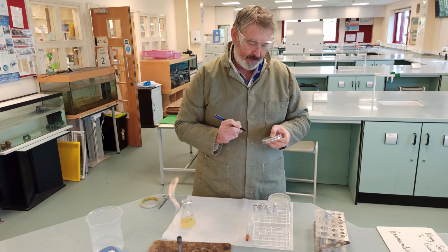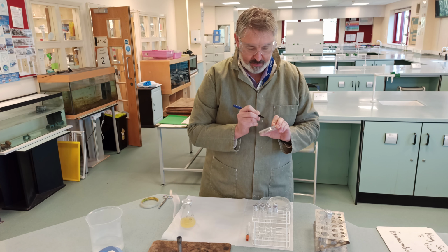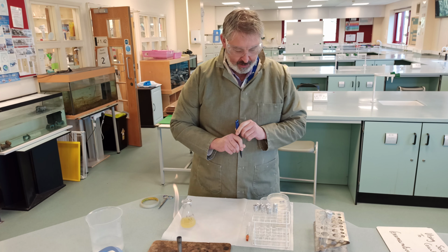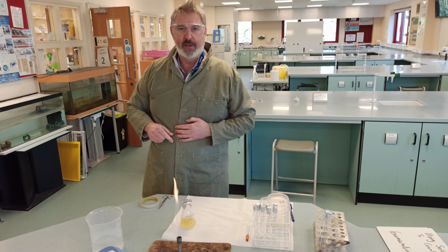Okay, and I'm going to put 0.1 on it. Okay, and so that will have 0.1 on it, and the next plate's going to have 0.01 times. Okay, so I'm going to dilute it down 10 times as we go through. Okay, so I'm going to stop now.